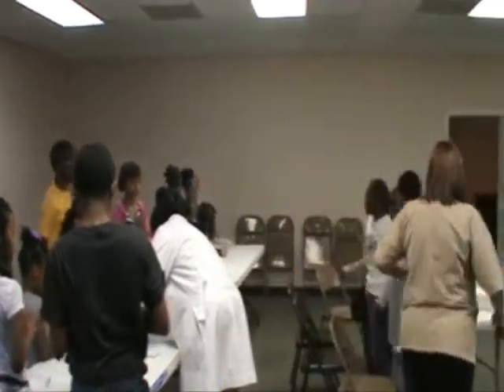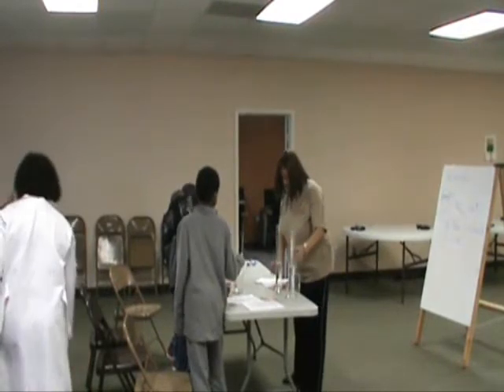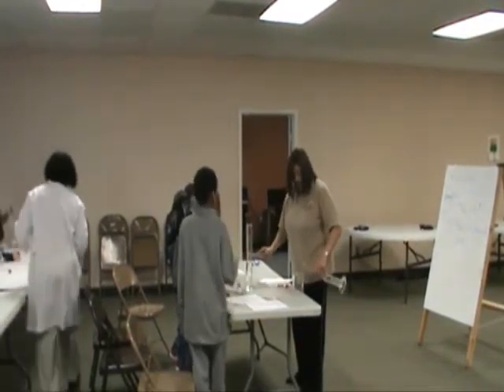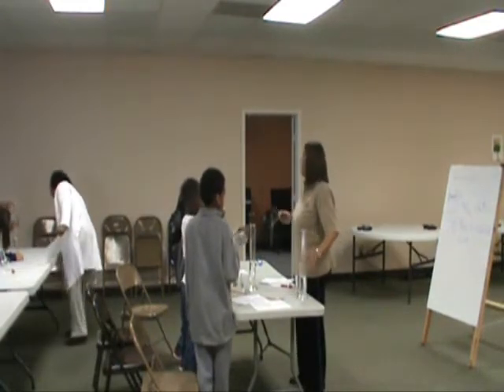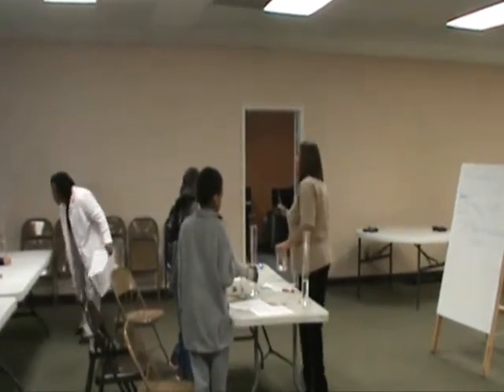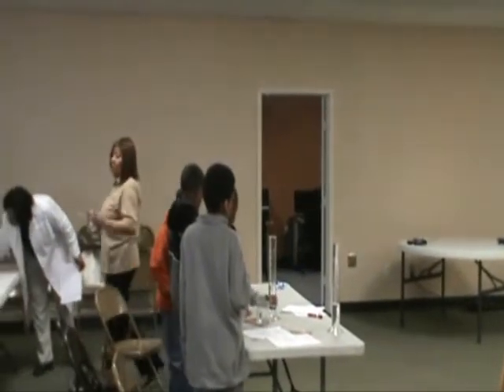All right, pick up your pipettes. Okay, pick up your pipettes. Excellent. Now, what I want you to do, after you get it close, just get it close. It doesn't have to be perfect. Get it close. We're going to show you how to make it perfect.